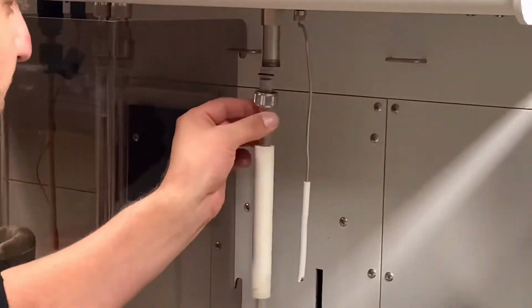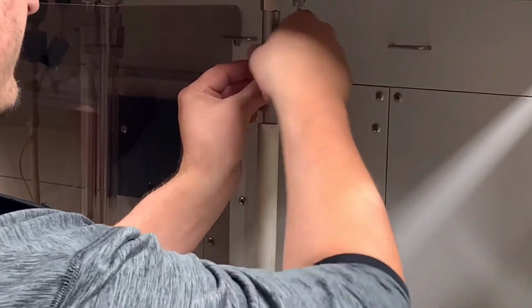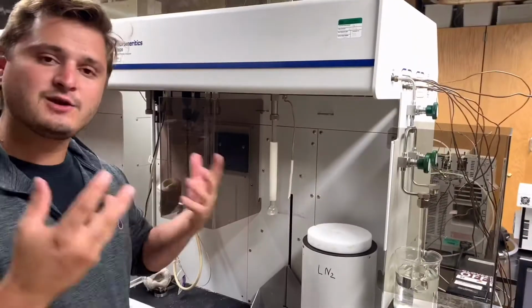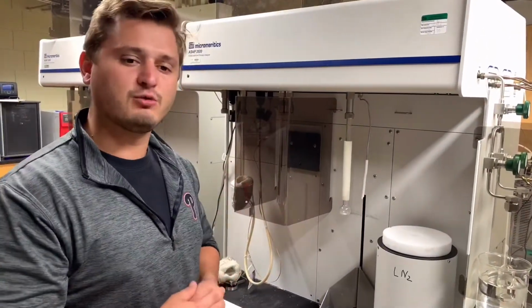and then screw on the sample tube hand tight until it stays there. Again, you just want to screw it on hand tight, not using a wrench or anything like that, but to make sure that there are no leaks.